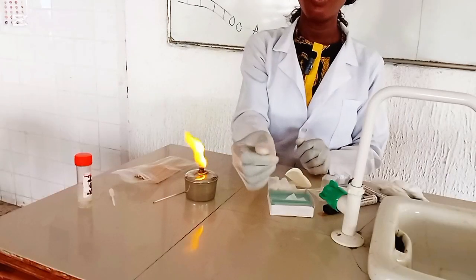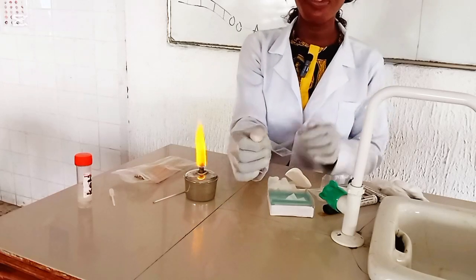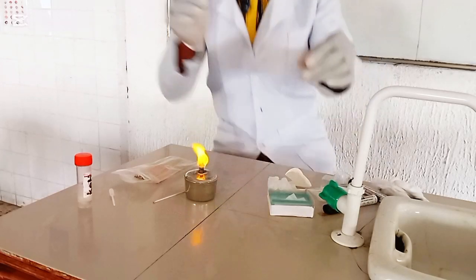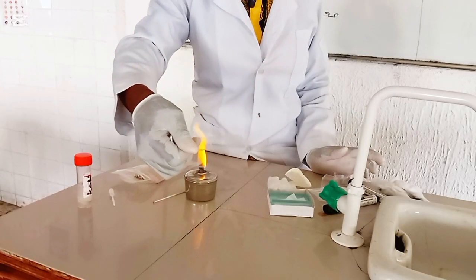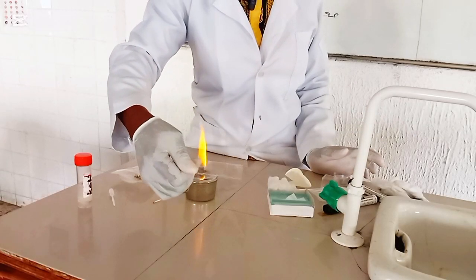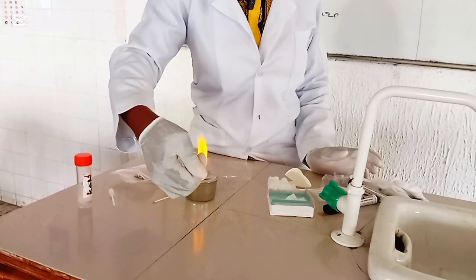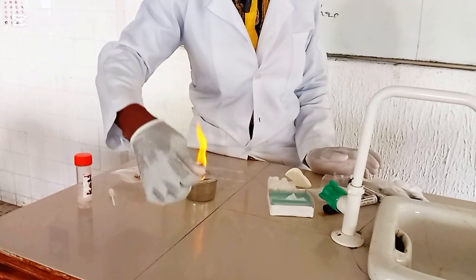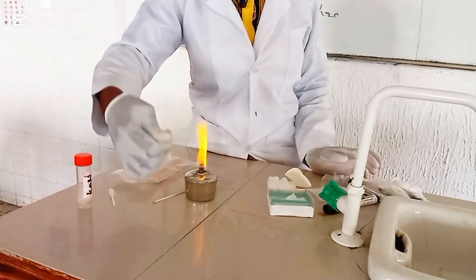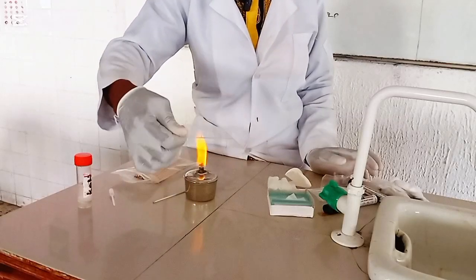So now, you see that the keratinous layer of the hair sample is out. This is how it should look if the keratinous layer is all dissolved. See how clear it's looking. So we have finally cleared the keratinous layer. Now it's time for us to view using our ×40 objective lens to check for the presence of fungi in this sample.